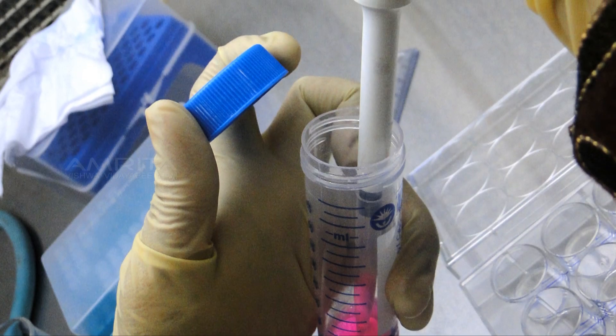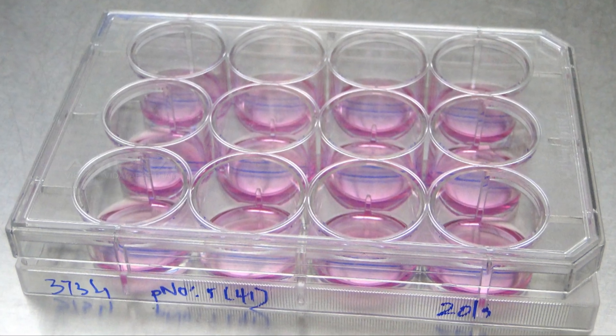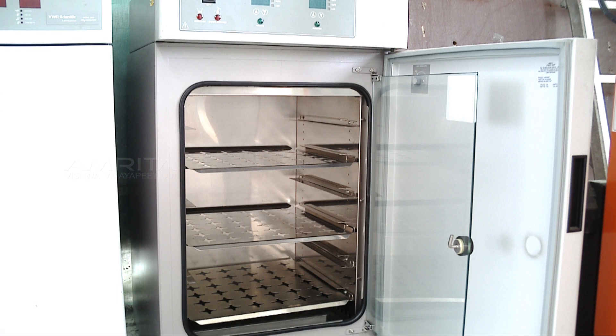Transfer 1 ml of culture containing media to each of the wells. Now close the lid and keep the plate in carbon dioxide incubator. Incubate the plate for 24 hours at 37 degrees Celsius.